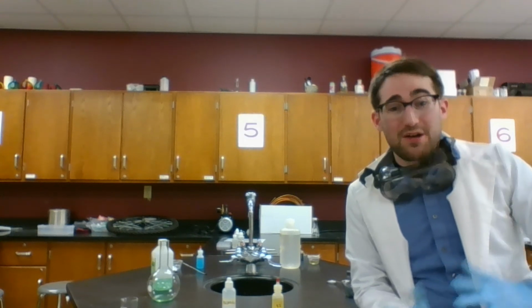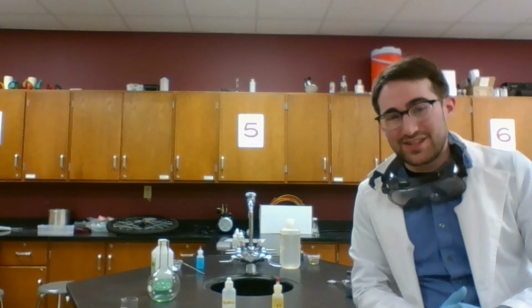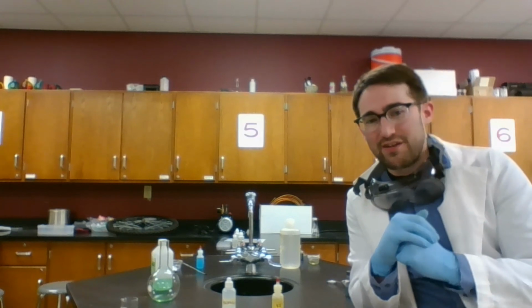Now in these 6 stations, you probably recognized a couple reactions that I demonstrated throughout the year, or maybe you saw in a different lab. Now we can actually figure out what's going on in that reaction. What type of chemical reaction is going on? What do we start with? What chemicals are there? And what do we change them into by rearranging their atoms?